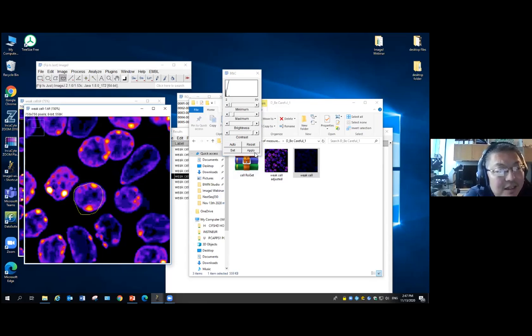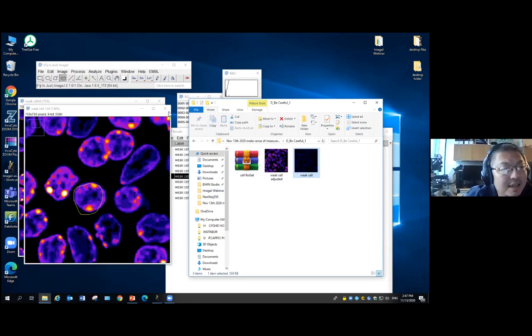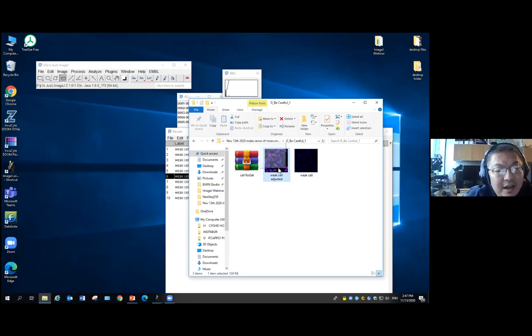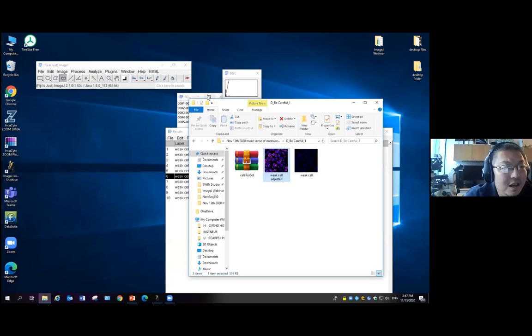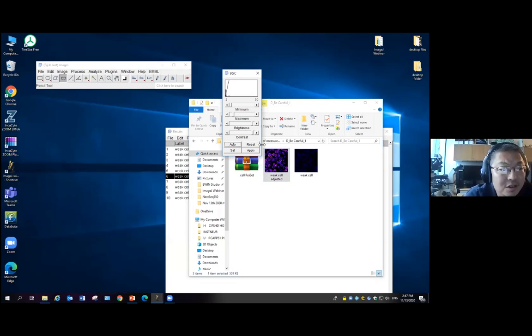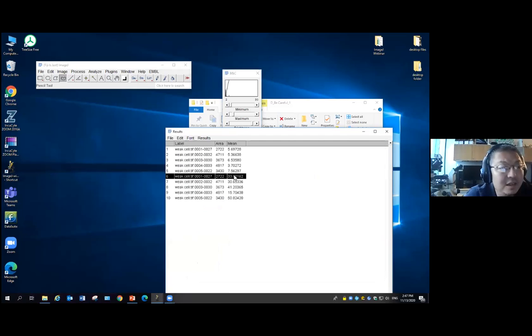The only thing I will do with apply is create the applied image, then save it, like here, I save it as the adjusted one. Then I load it into my PowerPoint just as a display to show people what the cell is. I'm not going to do any measurement on this because I know all the pixel information is modified. It doesn't represent the true information when we took the picture. So you just need to be careful. Sometimes you don't realize you clicked apply, and when you run the image, you will see the intensity change a lot.